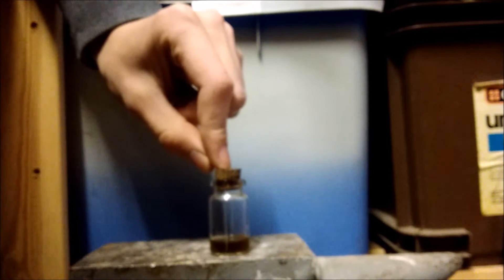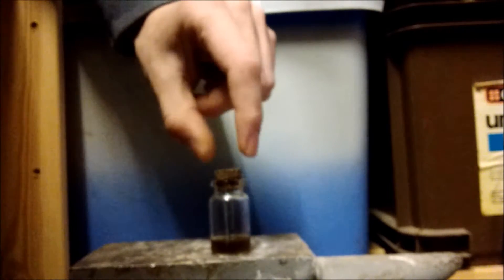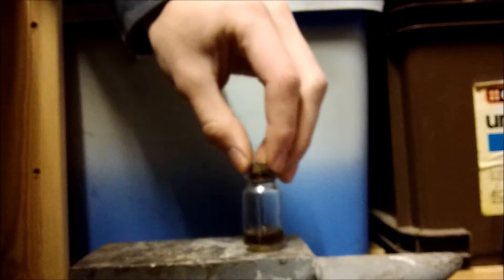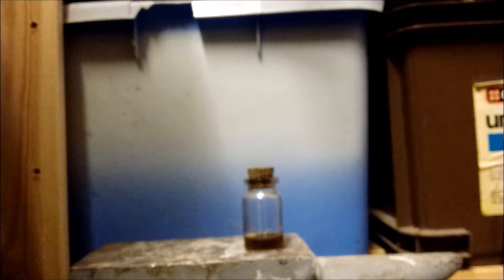However, I am having trouble getting it to crystallize out and it is taking absolutely forever. Now, I can't do what I'd usually do and boil it down because I risk thermally decomposing the carbonates, which is what I'm after in the first place, so it wouldn't particularly serve any purpose to try and boil it down.